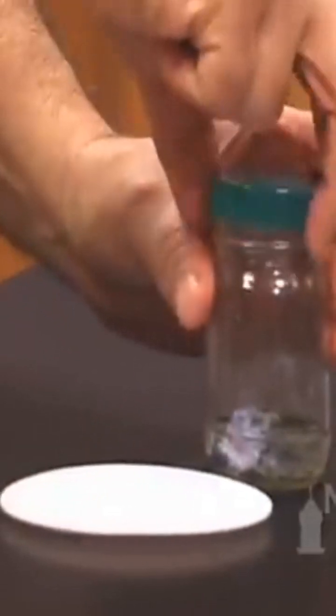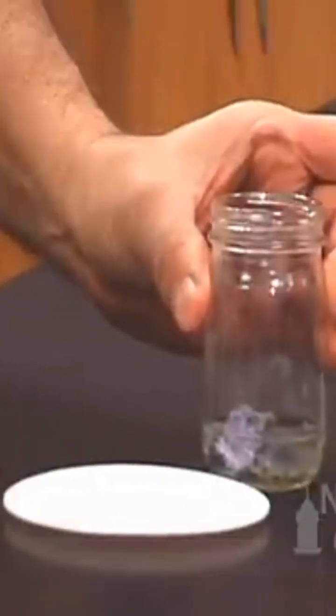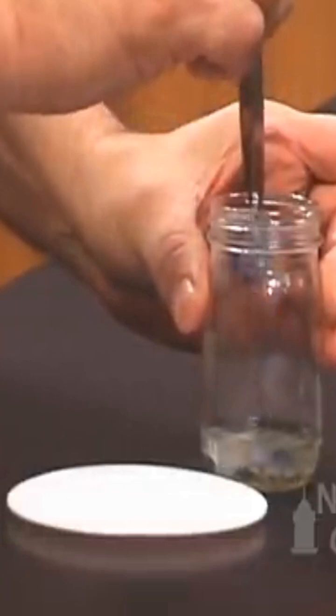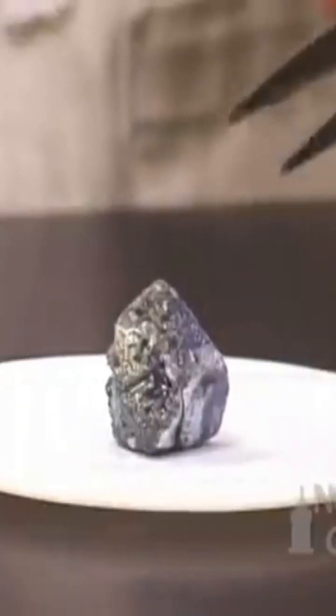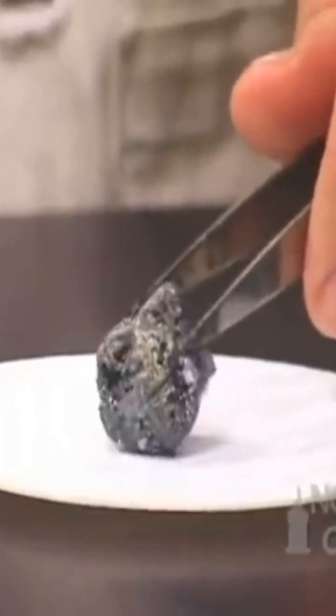If we remove a piece of potassium metal, we can see that the potassium is coated over with a gray coating of the oxide.